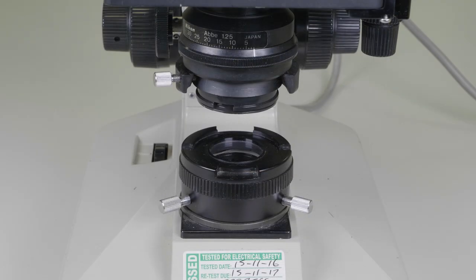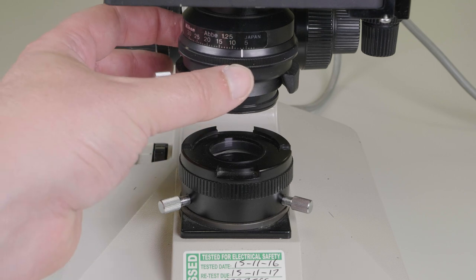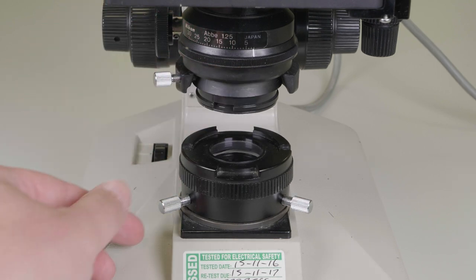Finally, the Nikon microscopes are again very similar to the Olympus microscopes. However, in this case the light path is controlled by thumbscrews on the field iris instead of on the aperture iris.